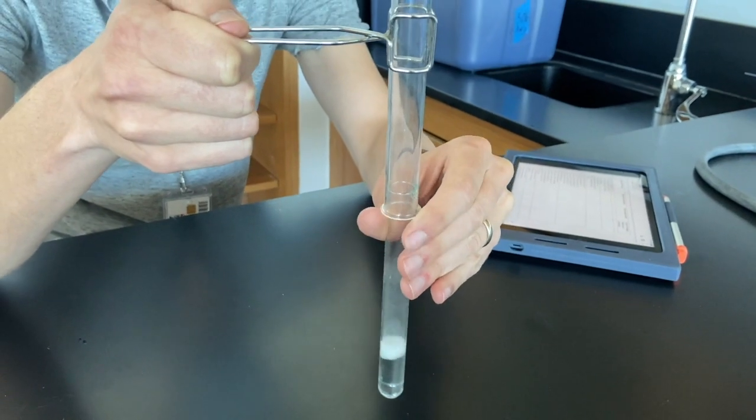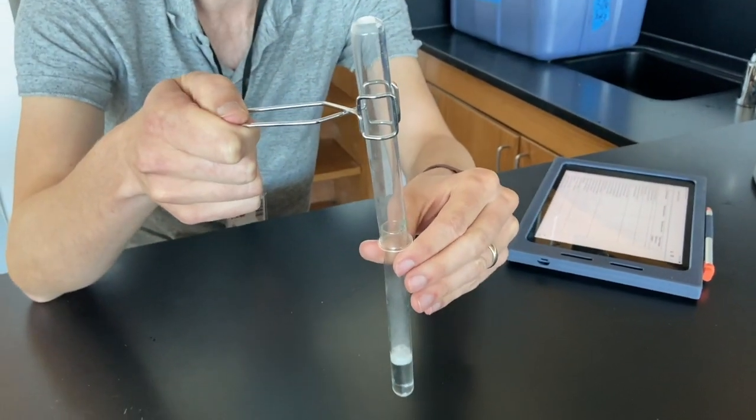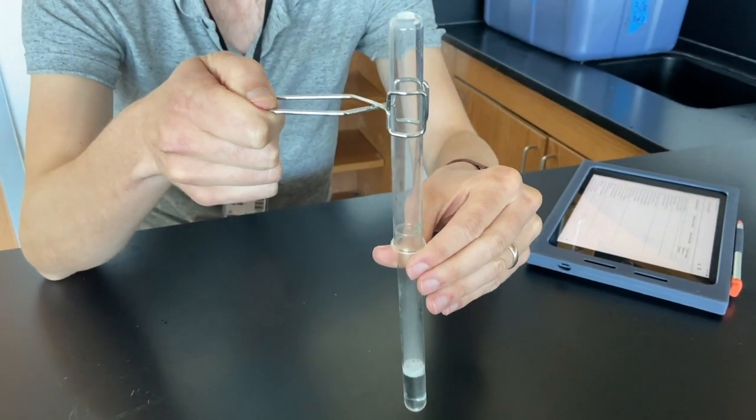I can also vouch that the reaction is producing a lot of heat. Nearly burned my fingers.